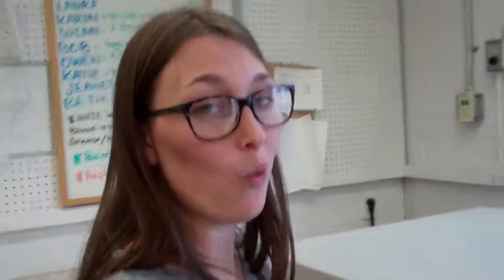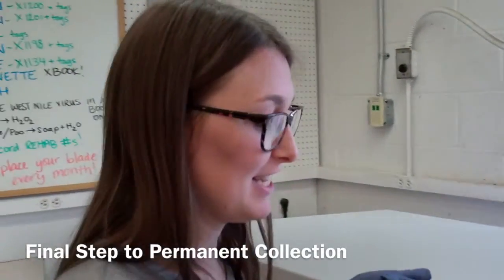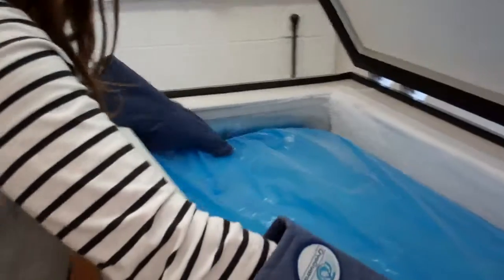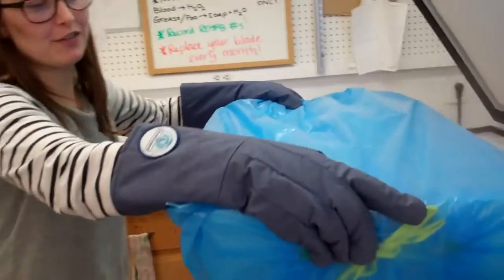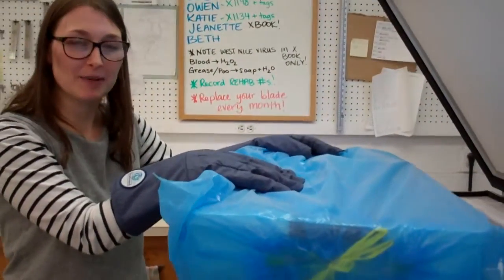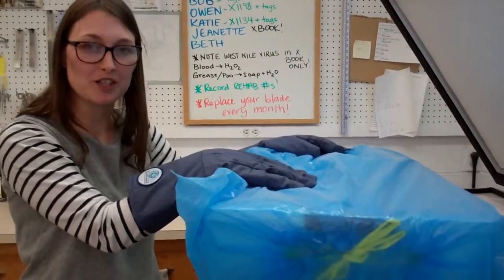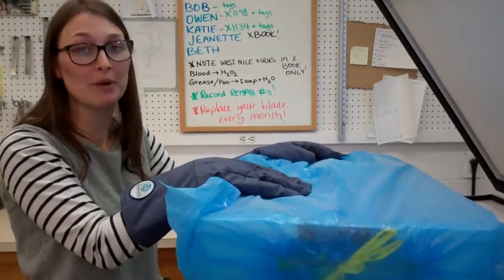Once our birds have been safely packed away in a tub for one week in our negative 60 freezer, these specimens are now ready to be transported to our collection where they will be permanently housed.